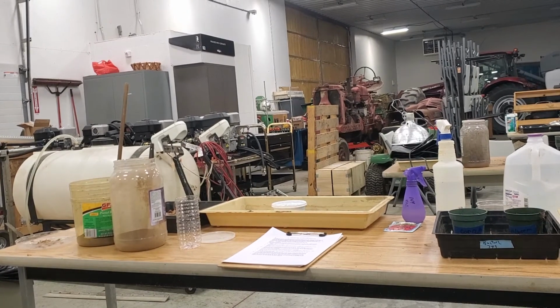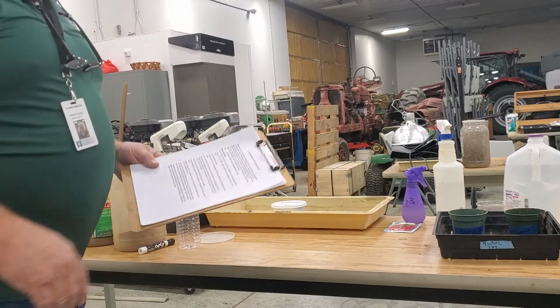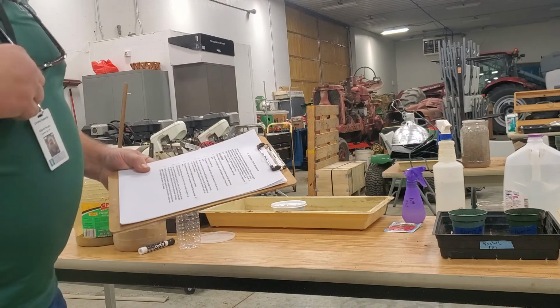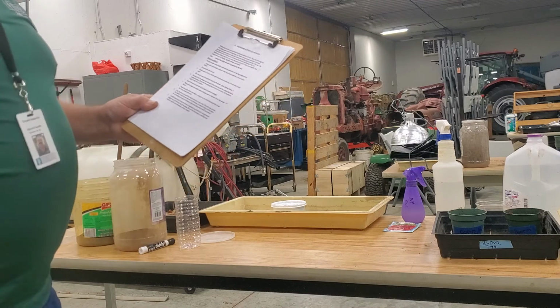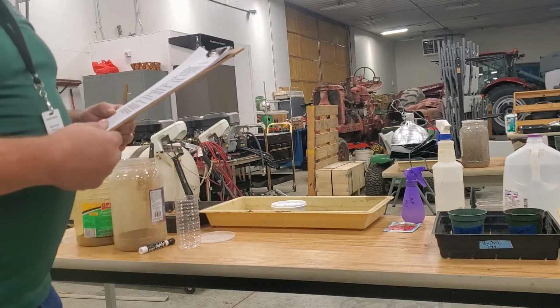Okay, now what would be handy here is if you stopped, if you're watching this and have not run off your sheets yet that are in the assignment, there's one called Earthworm Activity in Biology number 11. That's the first experiment we're going to do. So if you have that handy, it'll be easier for you to follow through. I'm going to read it though.